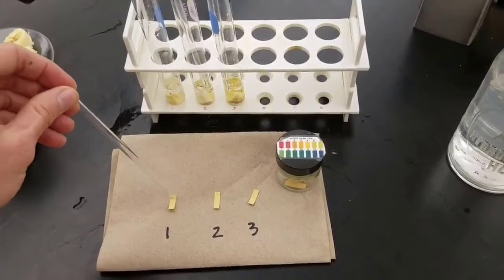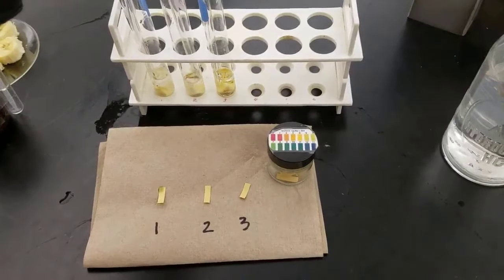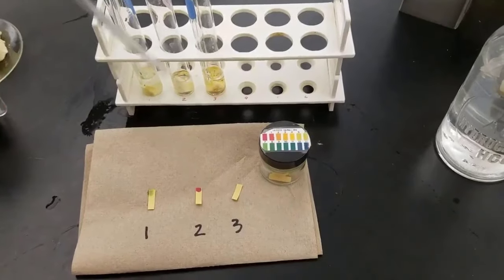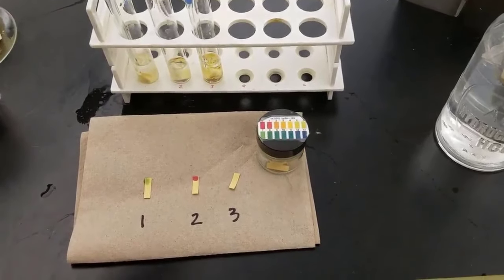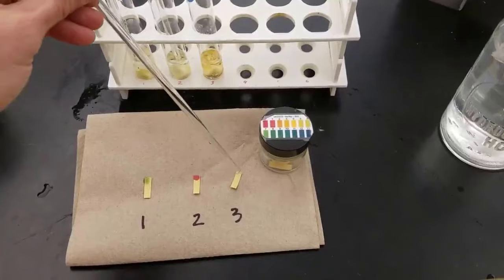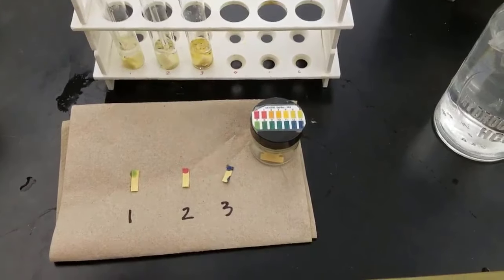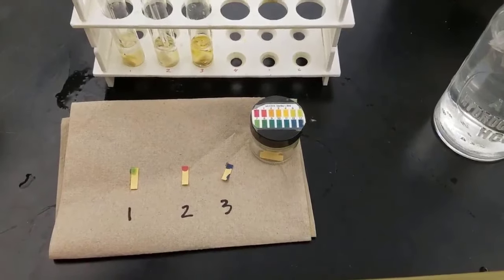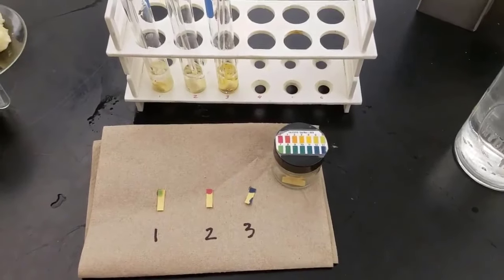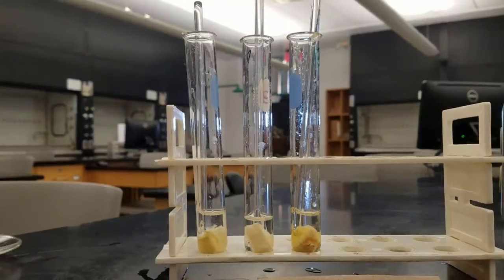Now we're going to test the pH. In test tube one, the pH paper turns kind of green — it looks like maybe six or seven pH. In the test tube with acid, we have a pH of maybe around one. And then the third test tube has a pH maybe close to 12 or even 13. Those numbers match with what we would expect.